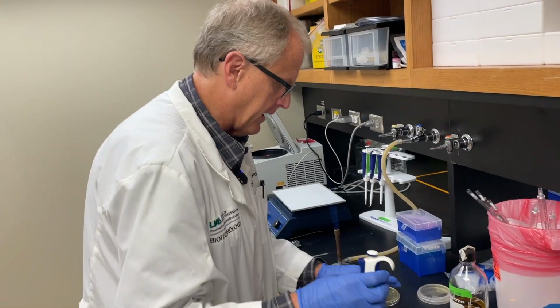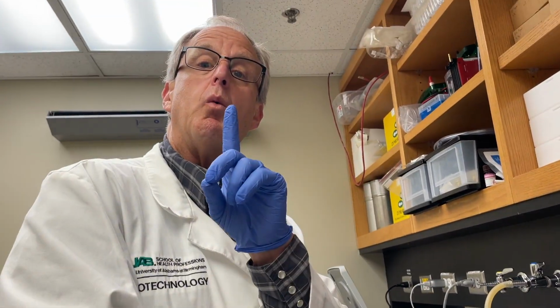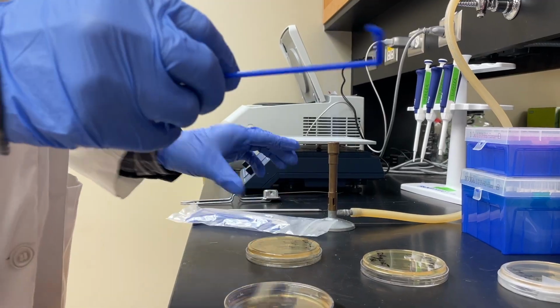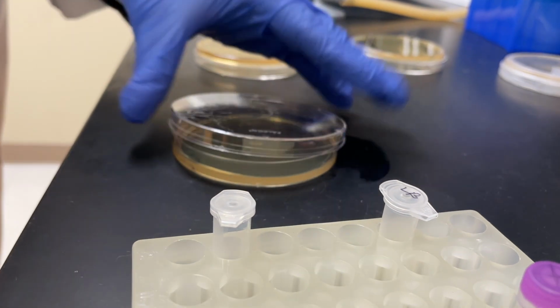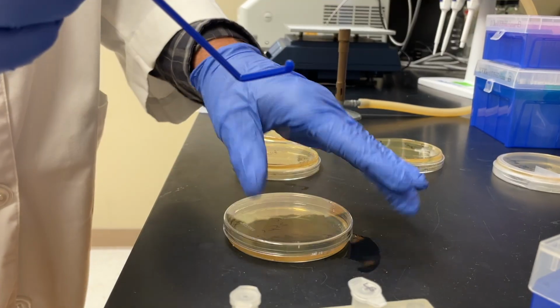Now we're going to put 50 microliters of our 1 to 10 dilution in here. The point is we want 1 colony. We only need 1 colony. So I'm actually diluting it out just a little bit so that I don't overwhelm it. Making sure we spread it out. Now, I'm going to add a little bit less, 25 microliters. There's multiple different ways to do this. I'm just adding less volume. Add to the center. You have to use a spreader, brand new one every time.